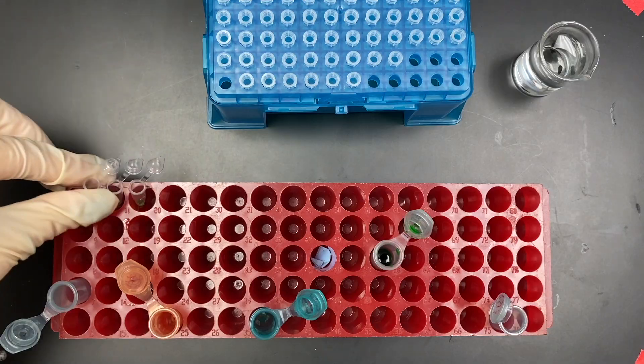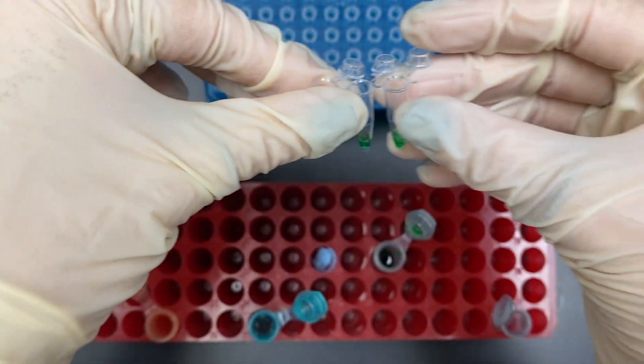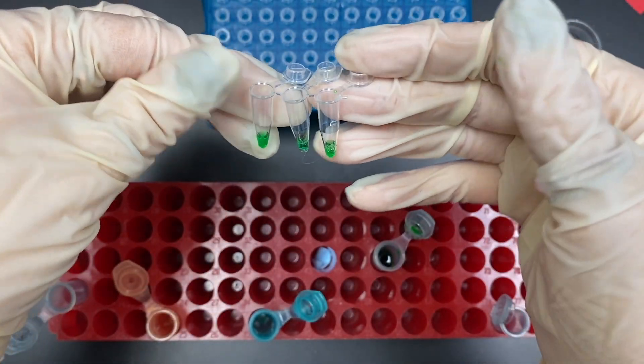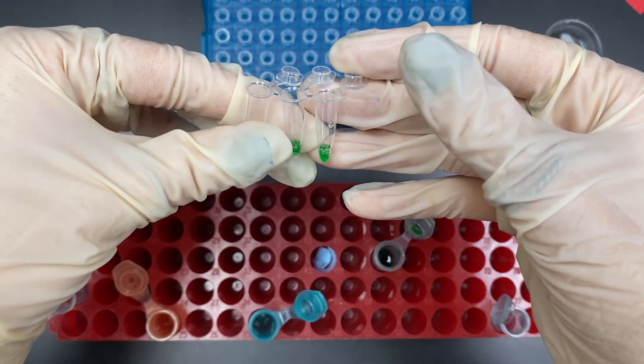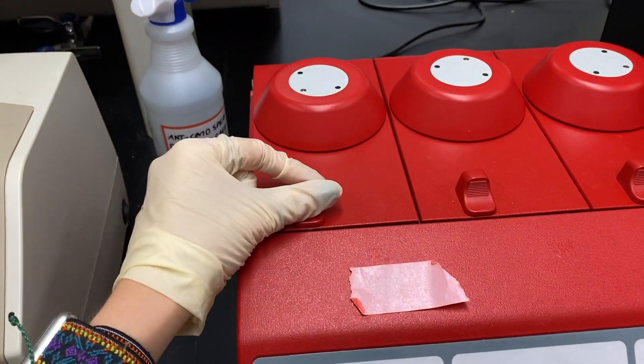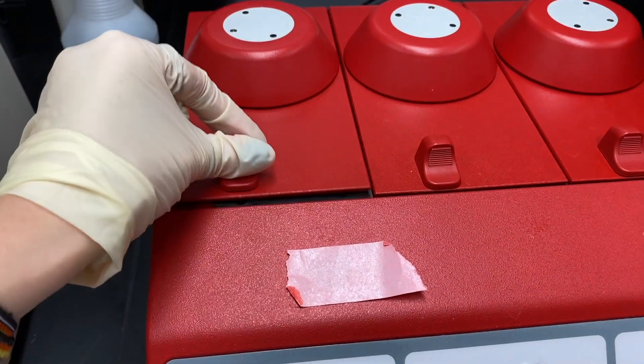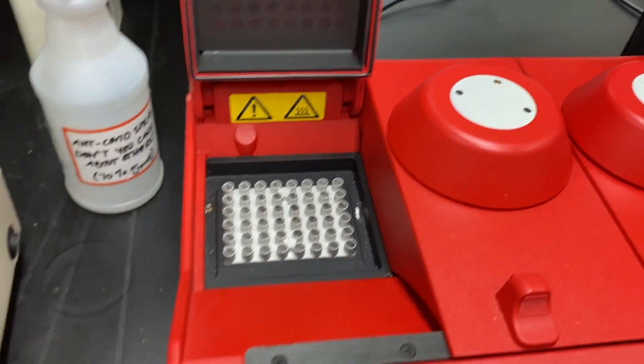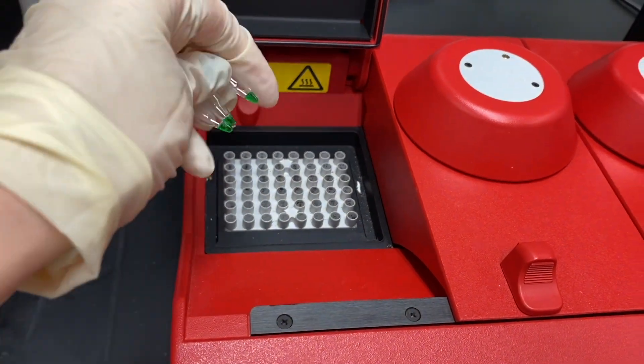And once I have the DNA and primers all mixed up, now I get to sit back and let technology take over for amplification. Amplification just refers to the process of replicating a specific region of DNA. It's sort of like searching for a needle in a haystack, but you have a magical self-replicating needle, making your chance of finding at least one needle a lot higher.